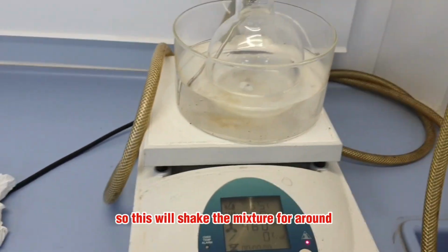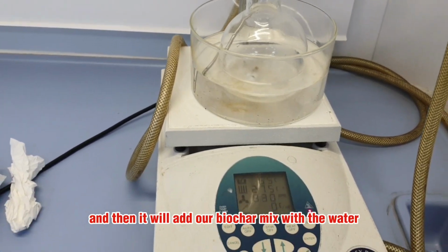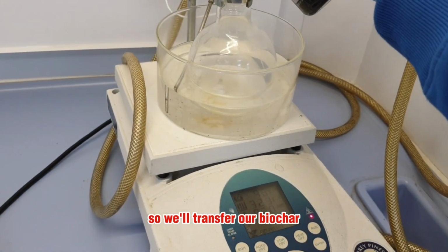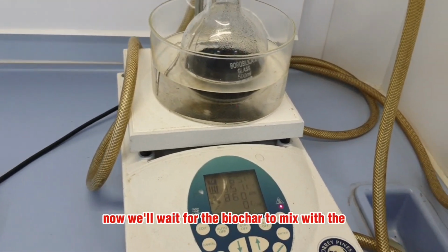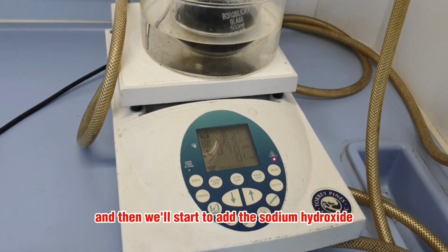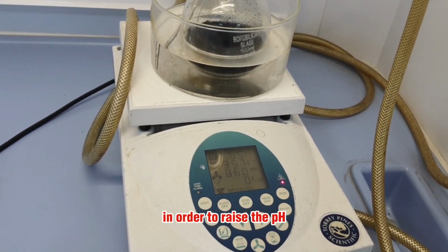So we will shake the mixture for around 5 to 10 minutes, and then we will add our biochar mixed with the water. Now the 10 minutes has been done, so we'll transfer our biochar. Now we'll wait for the biochar to mix with the magnesium aluminum salt, and then we'll start to add the sodium hydroxide, 1 molar, in order to raise the pH.